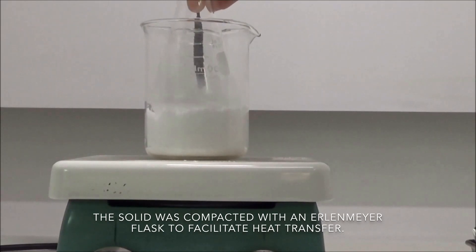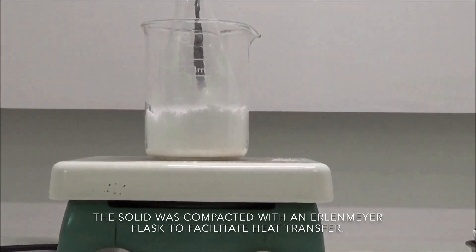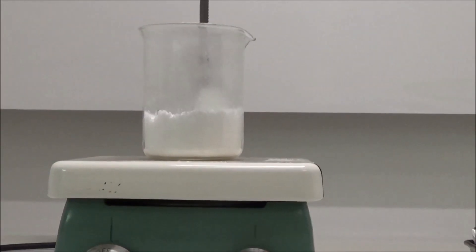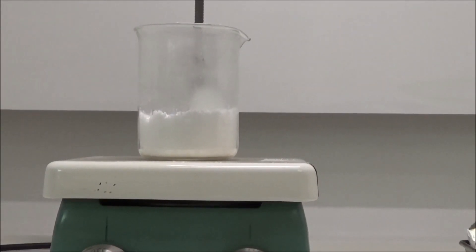Because of this, when you heat phthalic acid to around 180 Celsius, it begins to dehydrate, giving off water and becoming phthalic anhydride.